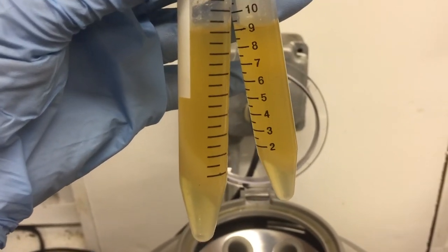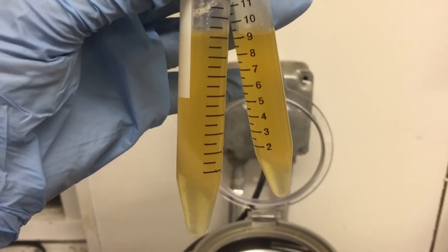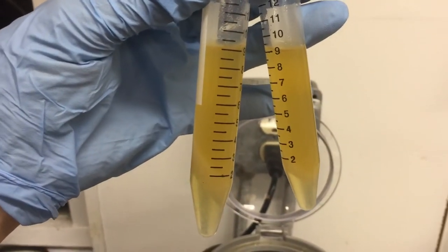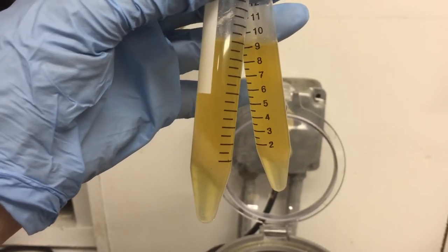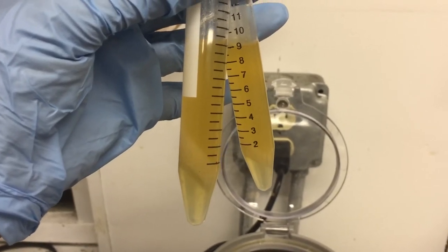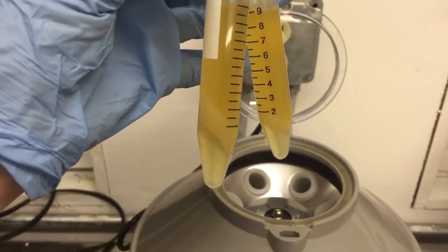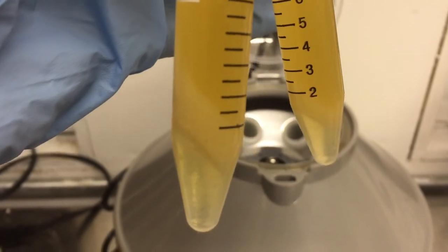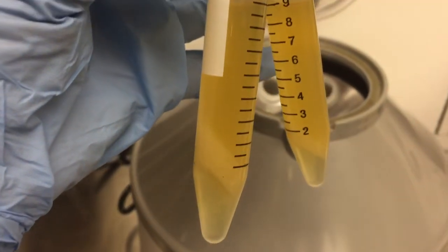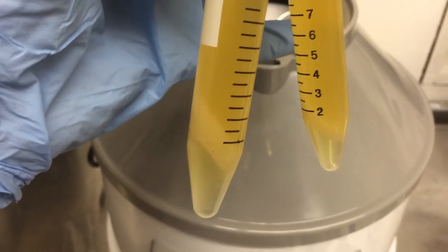So I'm able to extract any impurities or floral waxes, water, or alcohol — any of the unwanted elements after evaporation has occurred, and I can re-evaporate those components. The bottom layer I think is probably water, the watery hydrosol of lilac. The middle layer, the white part, is probably floral waxes — it's a solid and it's lovely smelling, but I can't use it in perfuming.